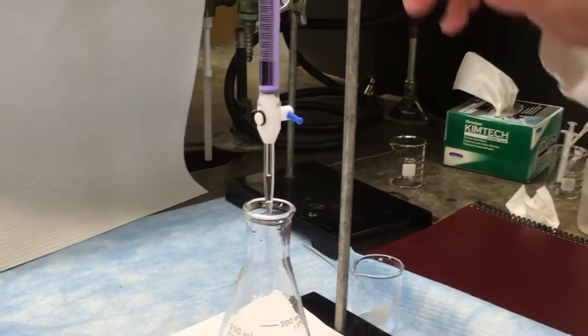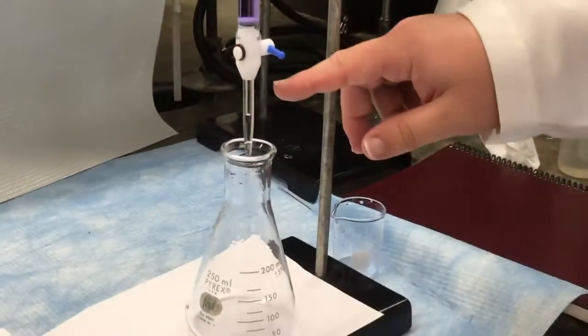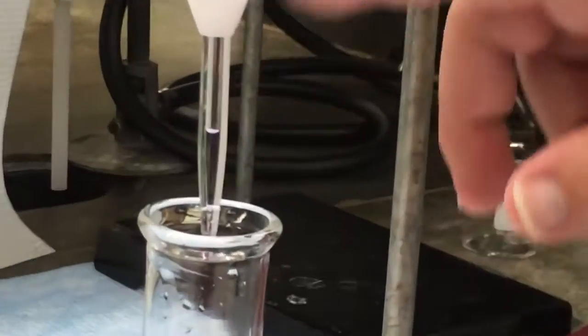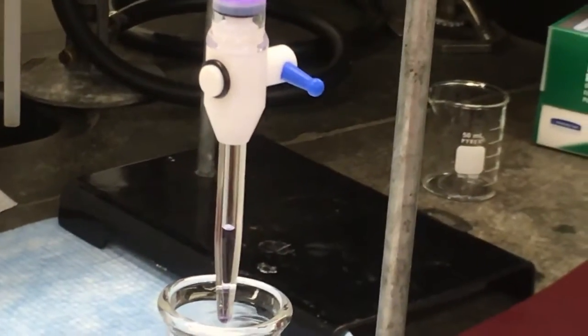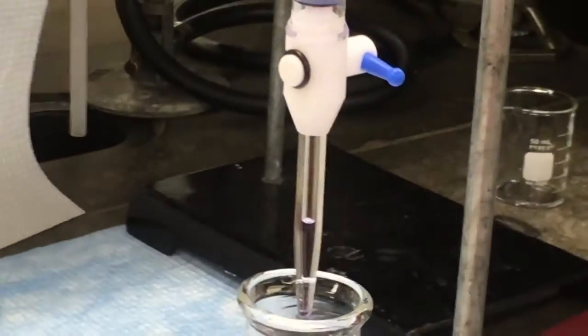In which case, you're just slowly adding dropwise, you make a note of where you stop. But either way, you go until you stop. This particular burette, by the way, it looks like there's a small problem here. You can see a bubble is developed there. That means there's a slow, a little bit of a leak there. If you saw that happen in the lab, you'd probably want to go back and either start over with this burette or get yourself a different one. But we'll just go ahead with it from here.